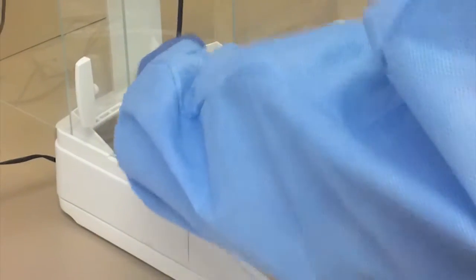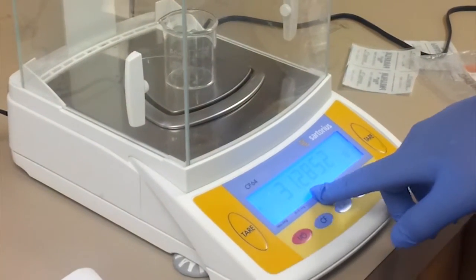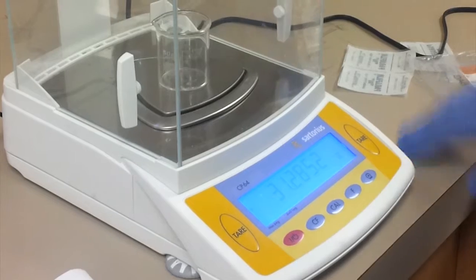Now I'm going to go ahead and mass out the beaker just to see how much it weighs. It is at 31.2852 grams.